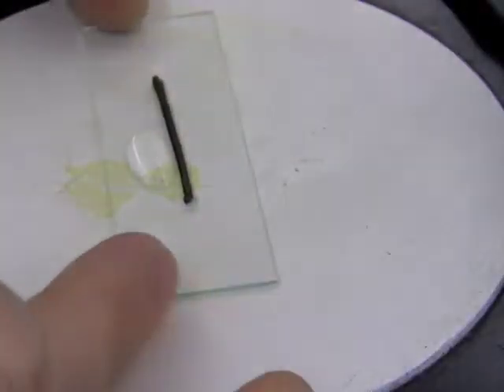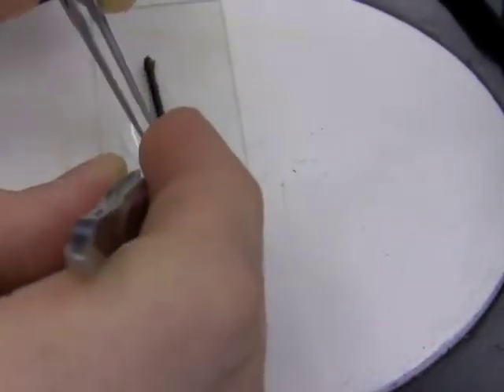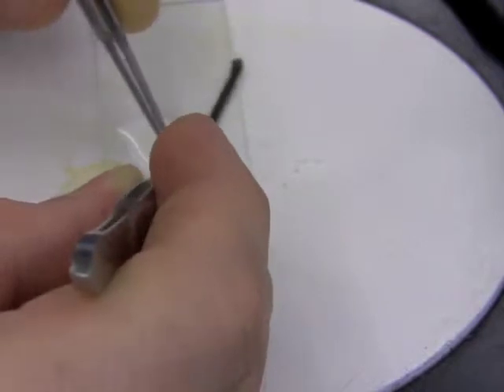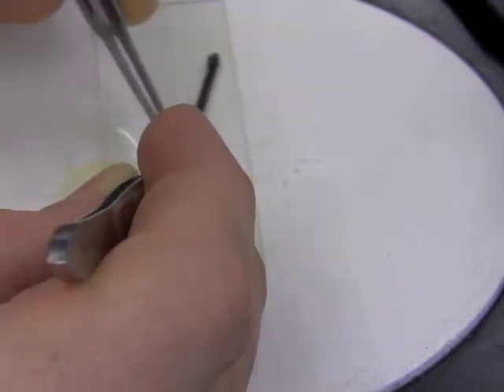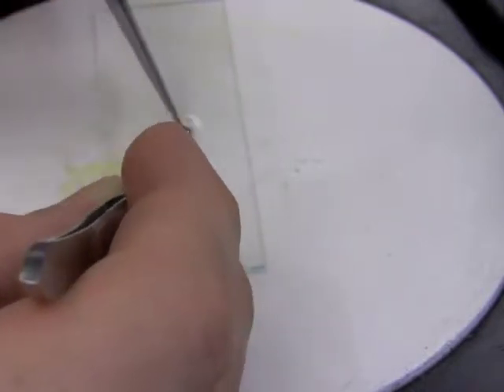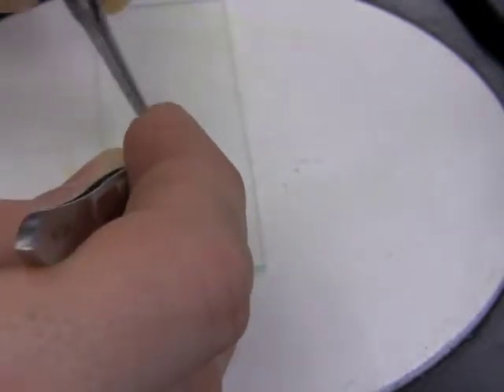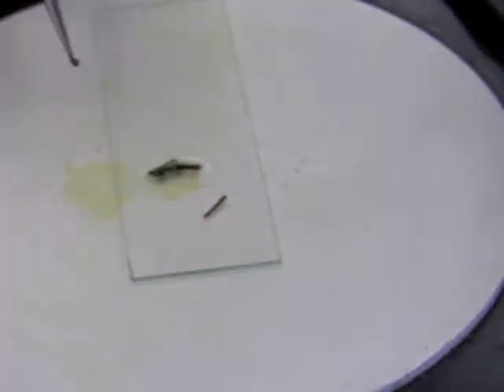What we want to do next is separate the gut from the rest of the exoskeleton. Here we have this video in fast motion showing the removal of the ventral plates of the exoskeleton, and removing the gut from right underneath, right on top of those ventral plates.